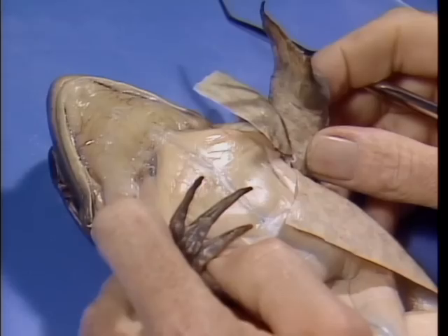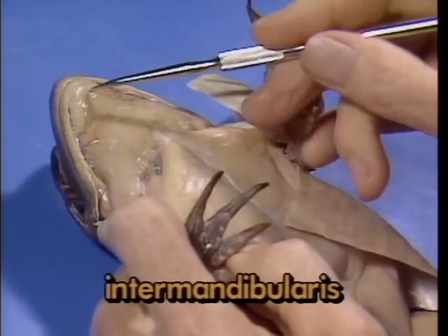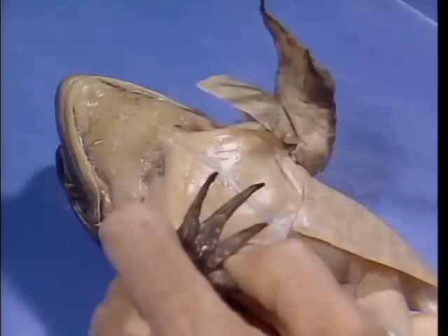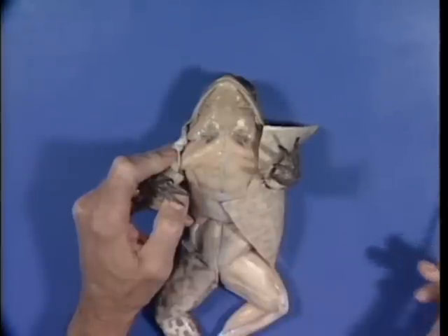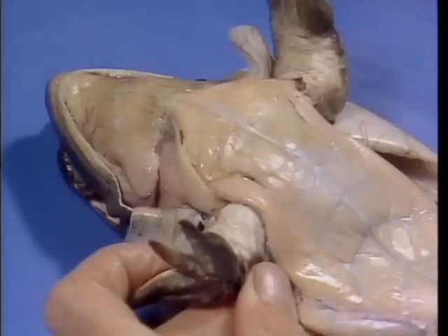Much of the chin is covered by a large muscle called the intermandibularis, which is involved in the swallowing process and also in the breathing cycle. The process of getting air in and out of the lungs of a frog is complex, involving coordinating opening and closing of the narial flaps and the glottis, while the chin muscles change the volume of air in the mouth cavity. In Section 5 on respiration, we will consider the breathing process in more detail. The majority of the remaining muscles are involved in body movements.